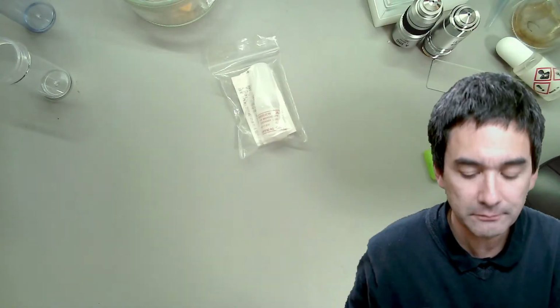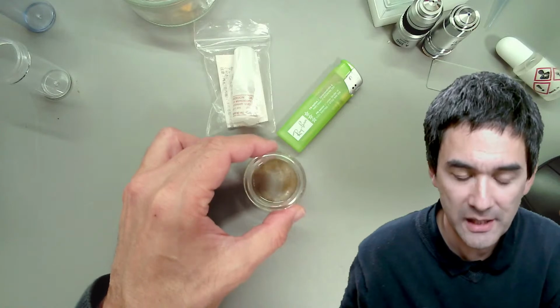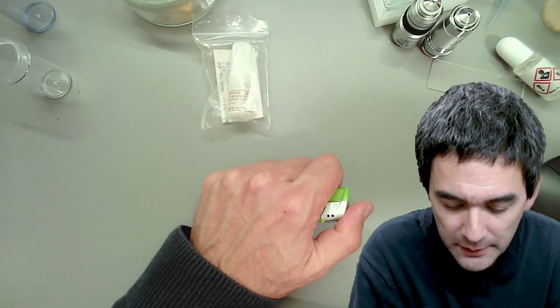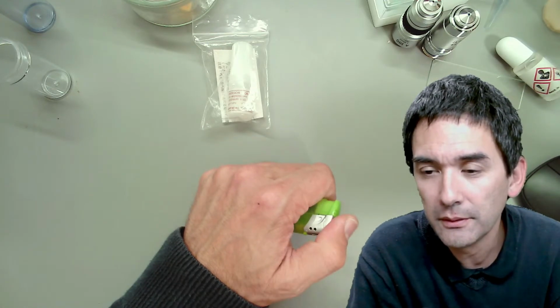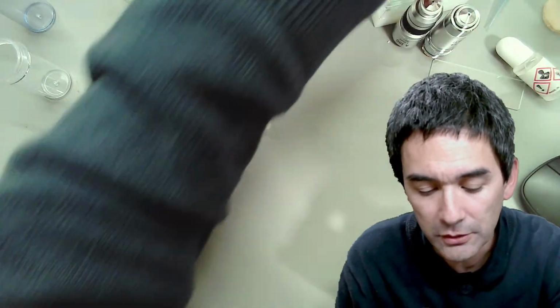What I will be doing now is, I've prepared here a small water sample, and over here a yeast suspension, and I need some lighter as well. And I'd like to now make a slide, and this is the thing that I would like to do now.